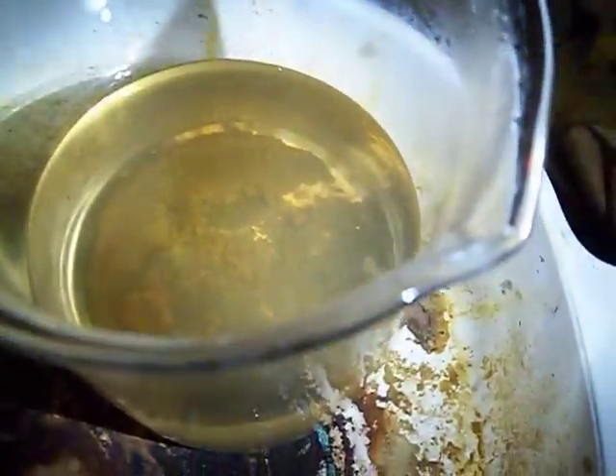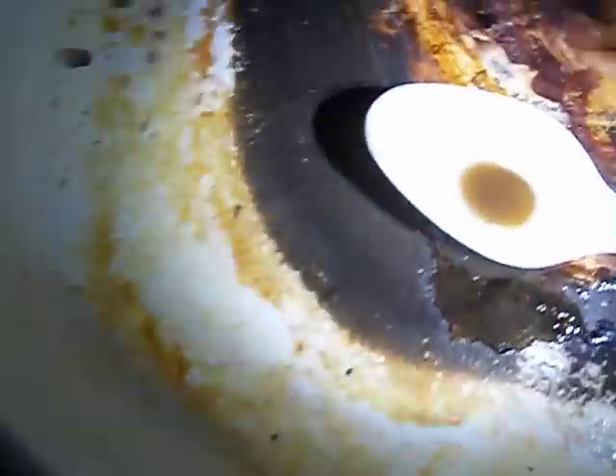So it's still got a lot of PGMs in the mix, but the stannous test took the gold out. I'll clean it up — definitely clean it up.